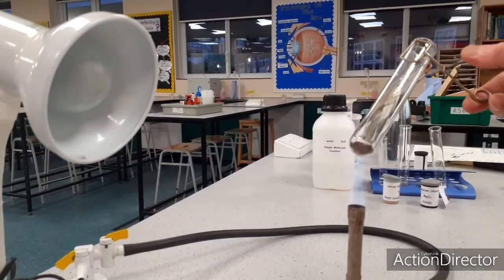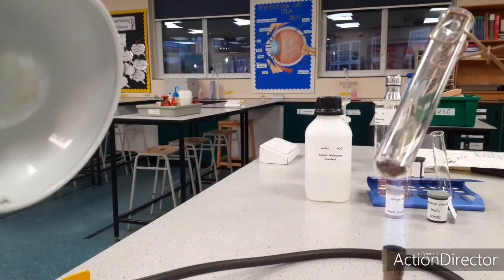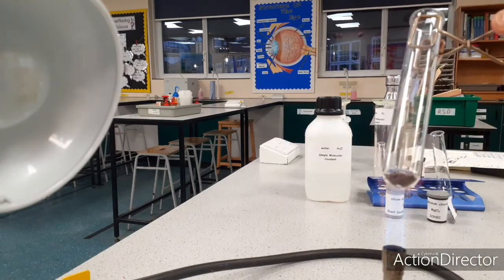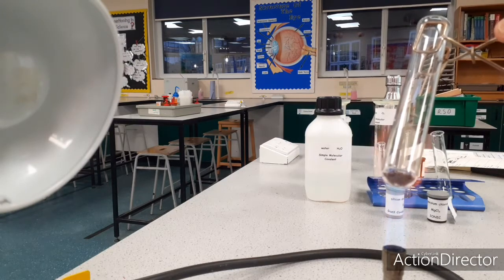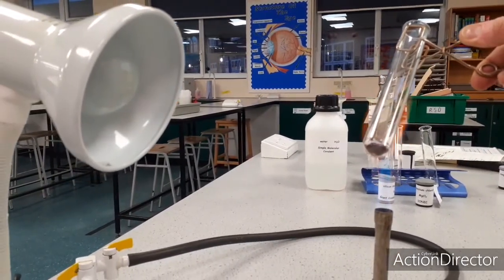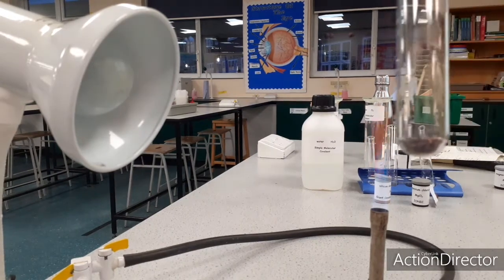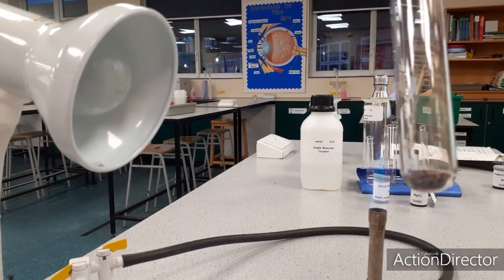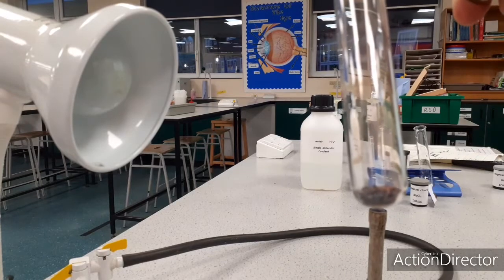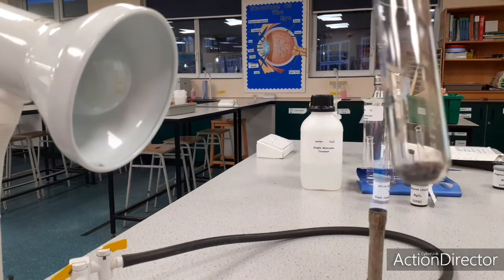And a simple way of testing whether the melting point is low or high is just transferring some thermal energy and seeing if we can overcome the forces of attraction between the particles, and heating this for a while. The camera's getting a little bit hot, so I'm going to bring the camera away. And you can see that actually if I heat this, it doesn't melt. So I'm going to conclude that our metallic substances have high melting points. Another clue is that they are solid at room temperature. So if something's solid at room temperature, we can conclude its melting point must be quite high.